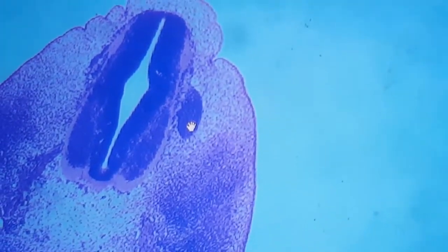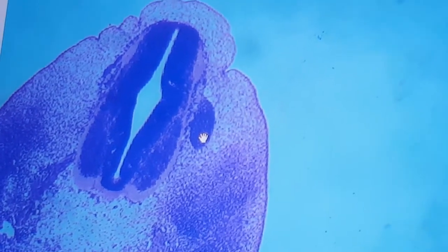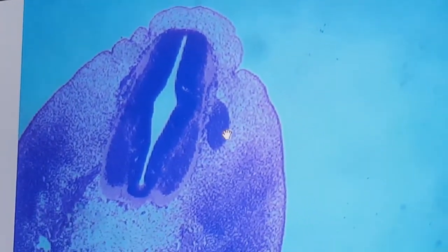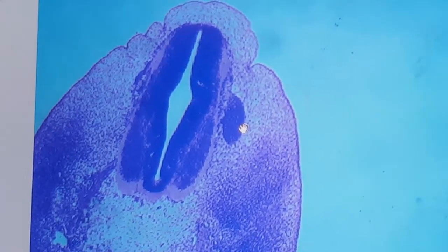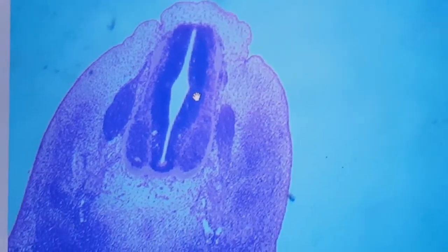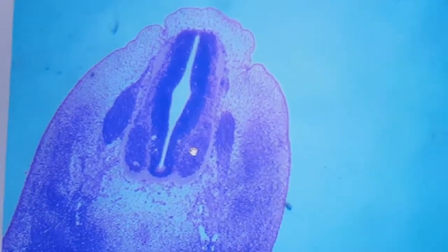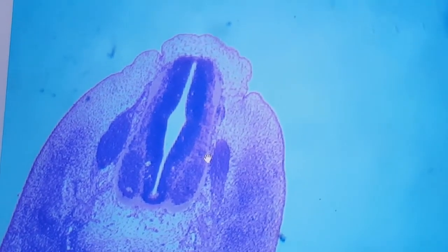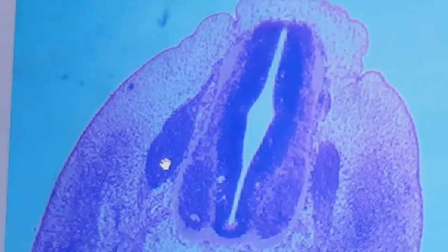And outside to the marginal zone, just look to this. Try always to differentiate this as the dorsal root ganglion. It is not the basal plate of mantle zone. It is lateral to the basal plate of mantle zone. So it is a dorsal root ganglion, which is derived from the neural crest. Again, in this section, this is the neuroepithelium. This is the basal plate of mantle zone, alar plate of mantle zone, and the pink color is the marginal zone. This is a dorsal root ganglion on that side and dorsal root ganglion on that side.